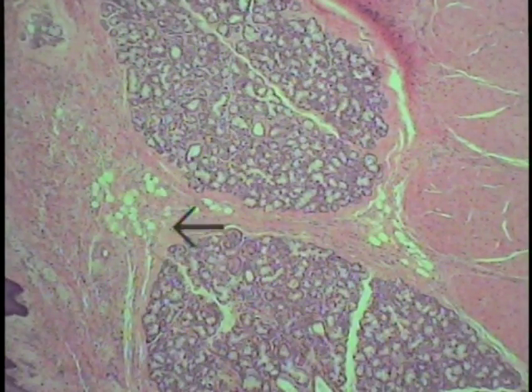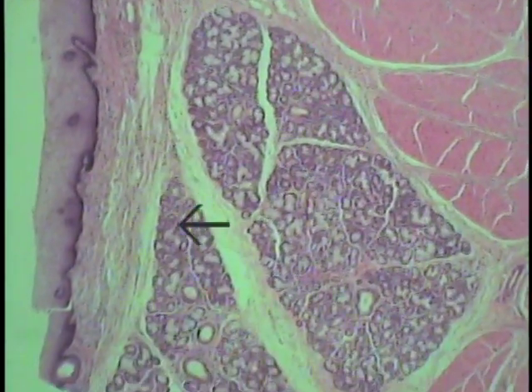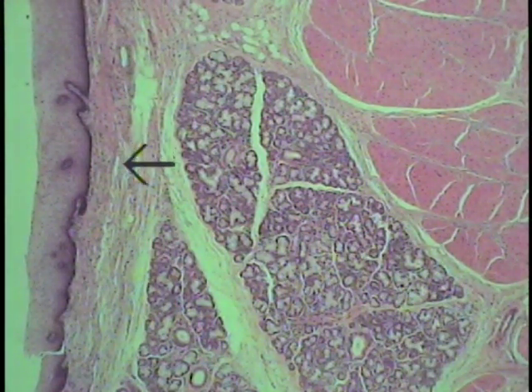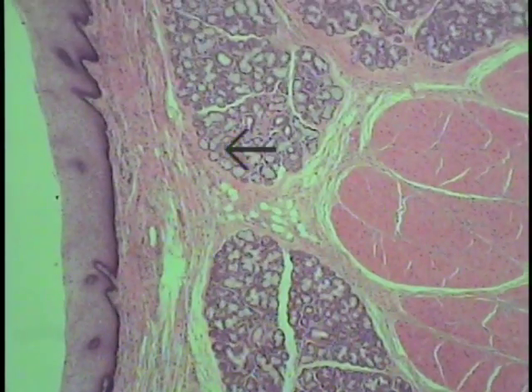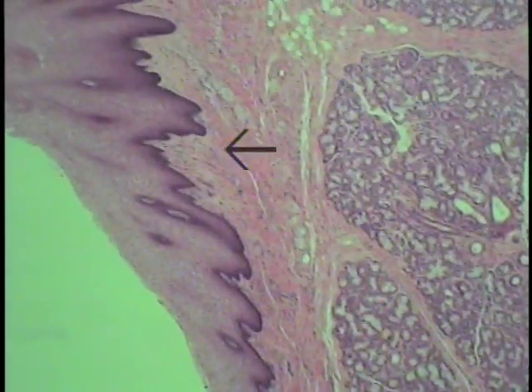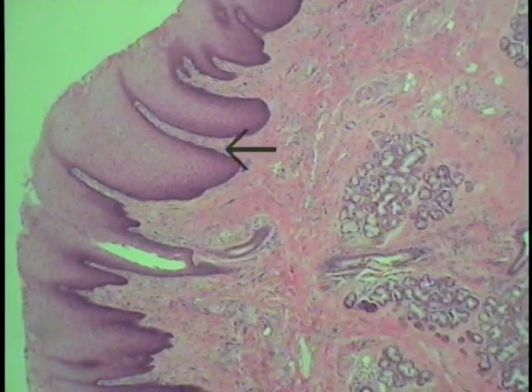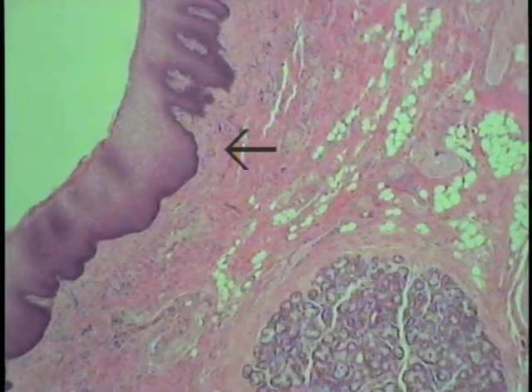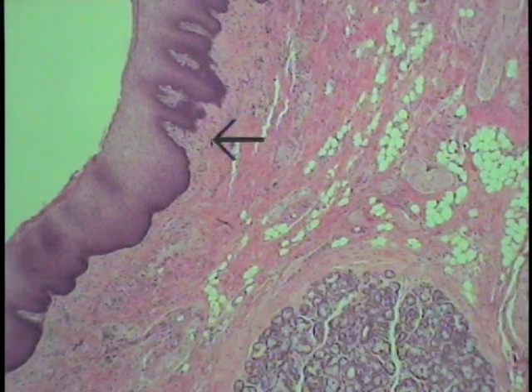Fat and nerve bundles are present in the submucosa, along with more minor salivary glands. The lamina propria and submucosa can be differentiated: the lamina propria is a finer connective tissue directly supporting the epithelium, while the submucosa is a coarser, looser connective tissue containing the glands. The submucosa here also contains fat, nerves, and the minor salivary glands clearly visible at scanning magnification.